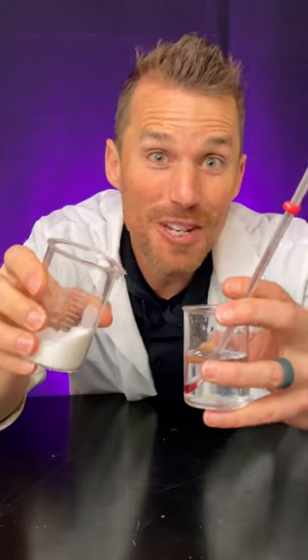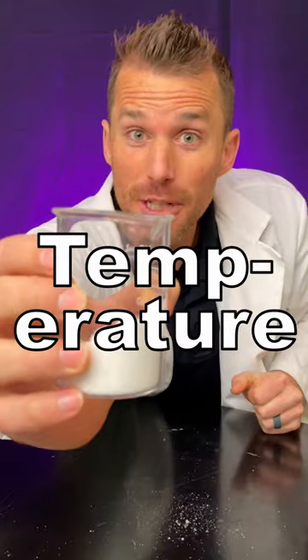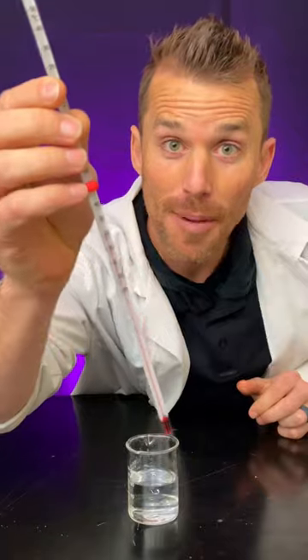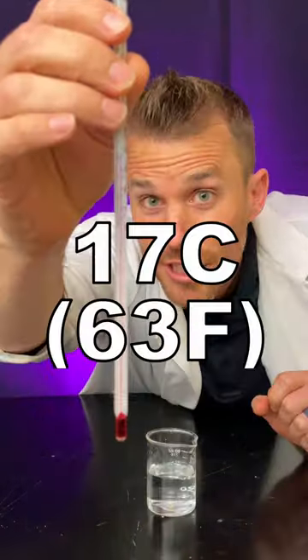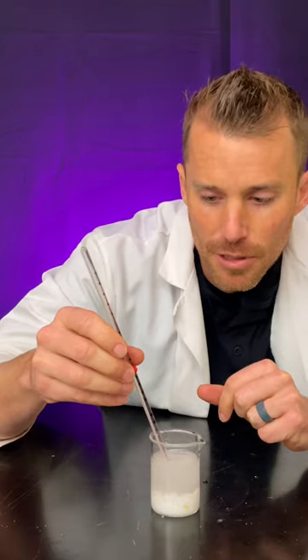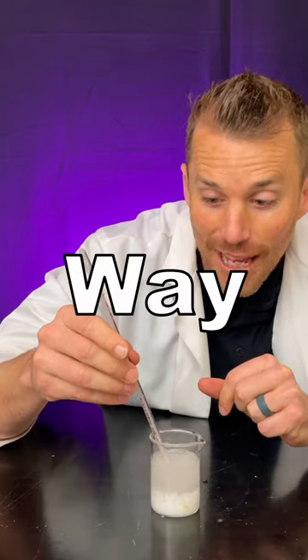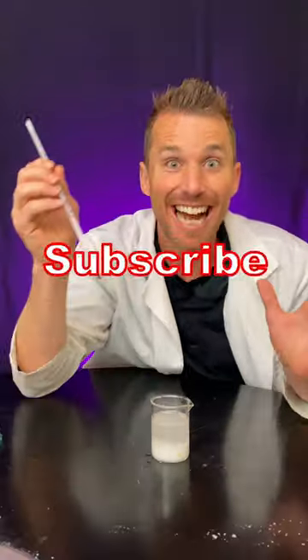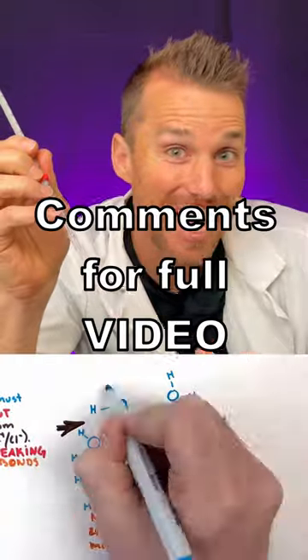What happens to the temperature of water when you add table salt? This is room-temperature table salt and room-temperature water. My beaker is now half full of water and the temperature is 17 degrees. Add salt, stir gently — or use a stirring rod if your students keep breaking your thermometers. Check out the temperature. No way — unbelievable. When I heard about this I had to try it to see if it worked. The temperature went down! That's because of the crystal lattice of the sodium chloride.